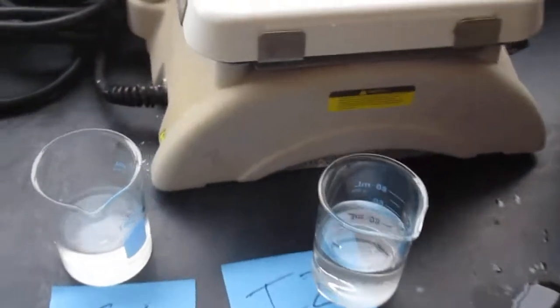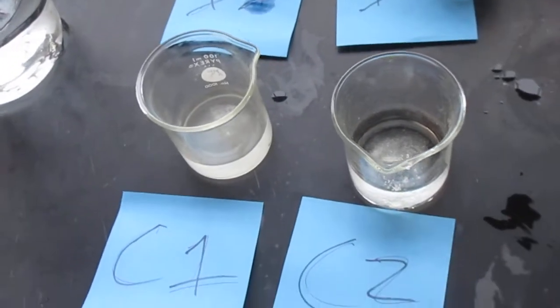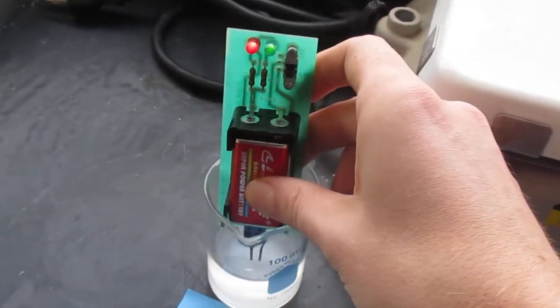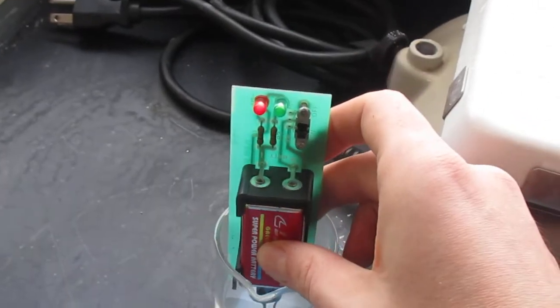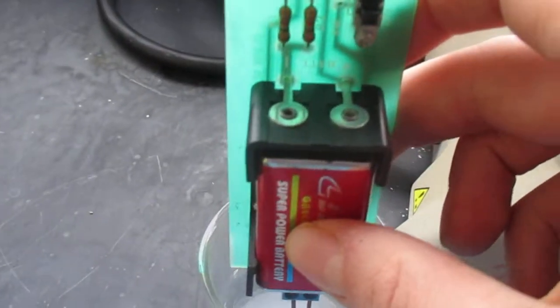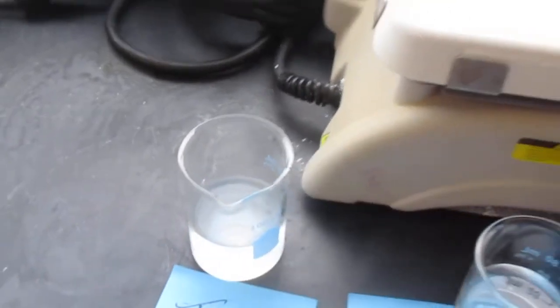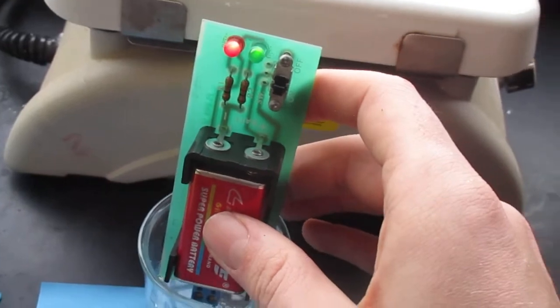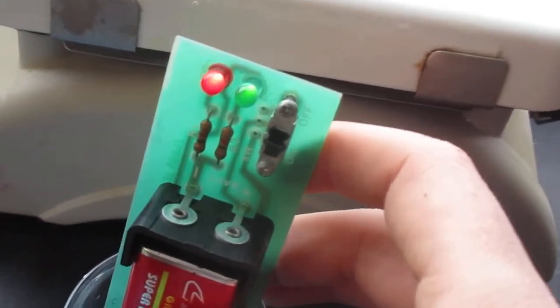From what we know about ionic and covalent compounds, hopefully we already know where this is going. That one both conducted red and green. That one is a brighter green, both are going on.